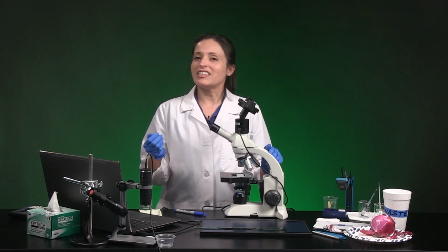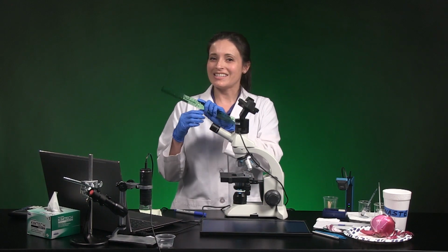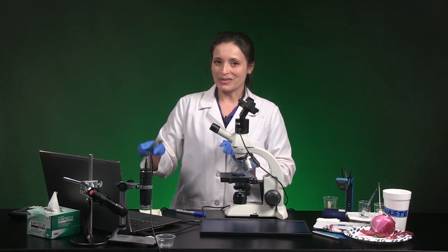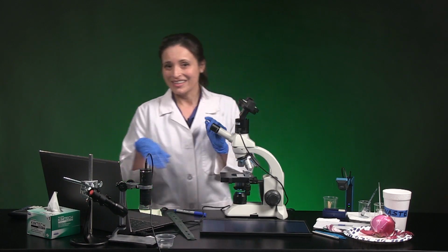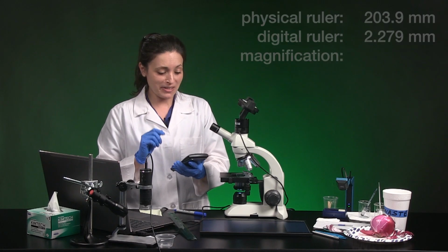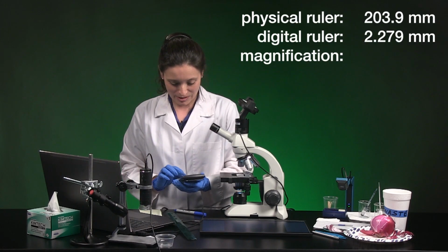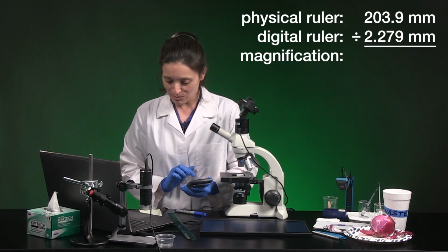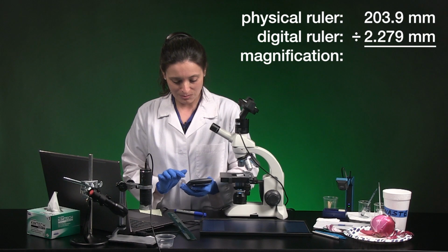The magnification is the metric ruler distance divided by the digital ruler distance. So on my screen, every time I use the 4x objective lens, the magnification is 203.9 millimeters divided by 2.279 millimeters.